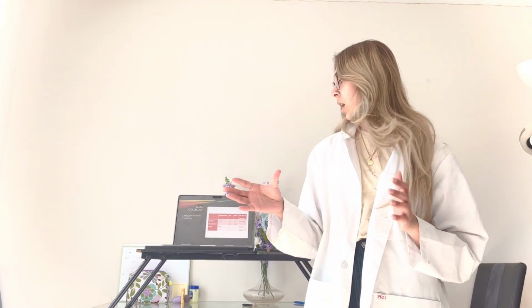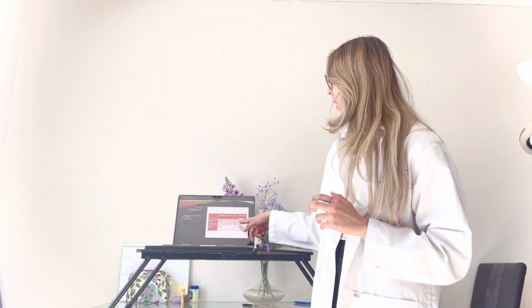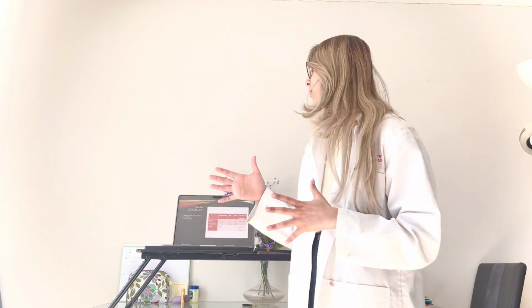Some of the data collected from that whole product was simply the melting temperature of the product, which was determined. As we can see here, the product on the 28th day had a melting temperature of 109 to 110 Celsius. It varied when I took the melting point. So that was that on the 28th day. We do that because we try to dry the product itself, so you have to wait for that product to dry. So I just let it sit in my locker.